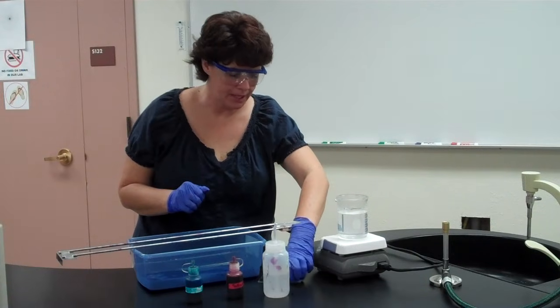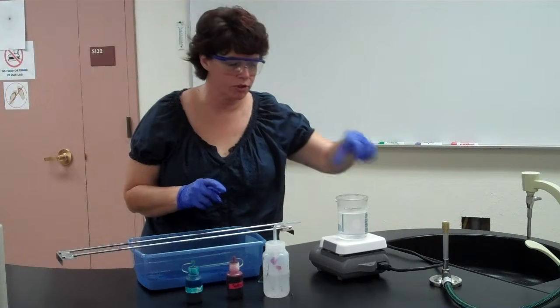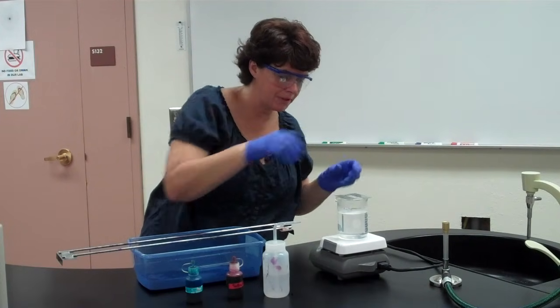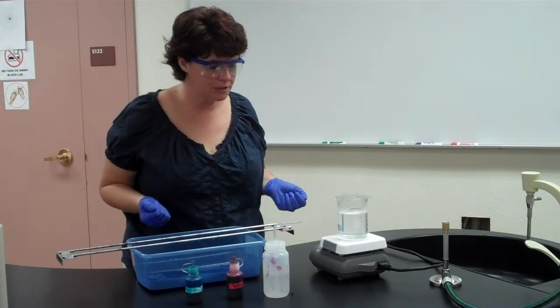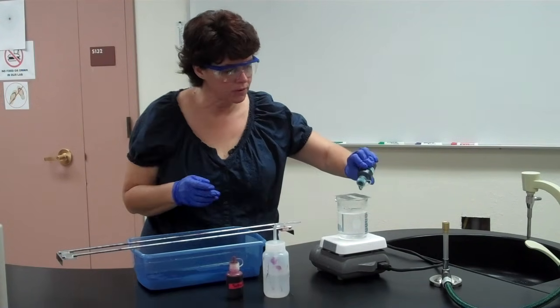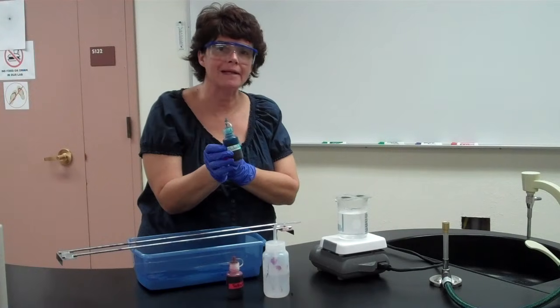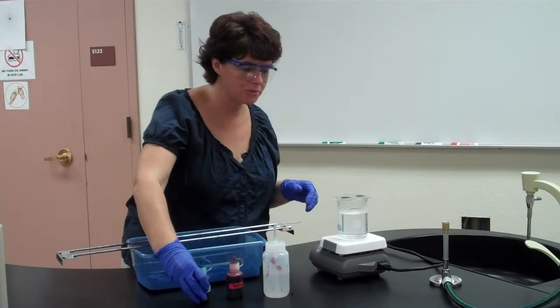So just as we did with the acid-fast stain, we're going to put our slides that already have a fixed culture on them that are labeled, mine aren't, on our heat. And once again, we don't need it rapidly boiling, we just need to see steam coming off of it. So I can see the steam, the condensation forming. As we did with the acid-fast stain, we're going to drop the stain on there. The first stain in the endospore stain is called malachite green. So we're going to put our malachite green on there, making note not to get too much in the water.